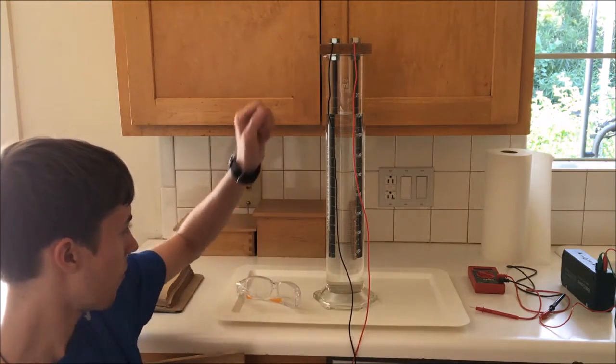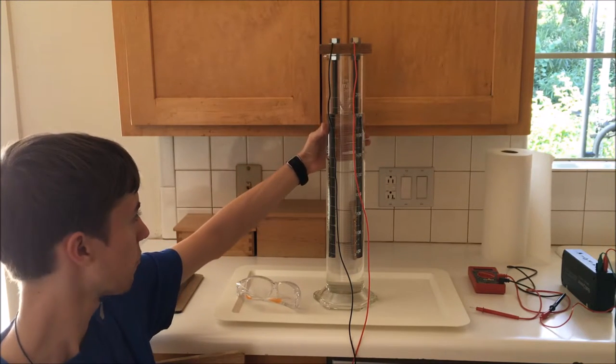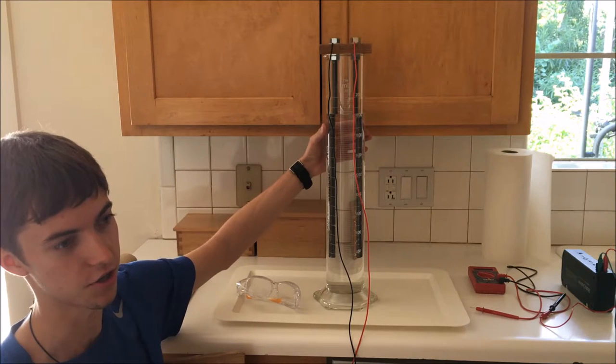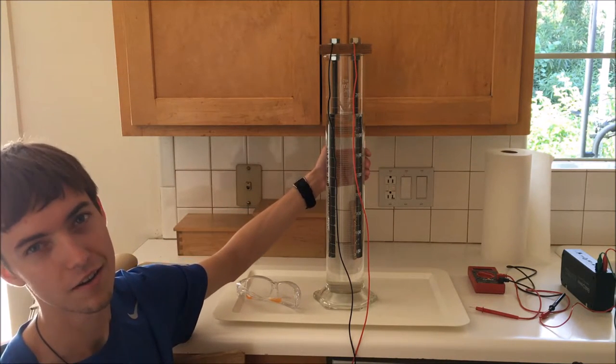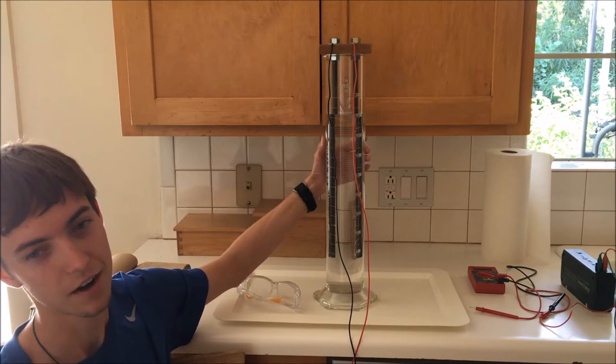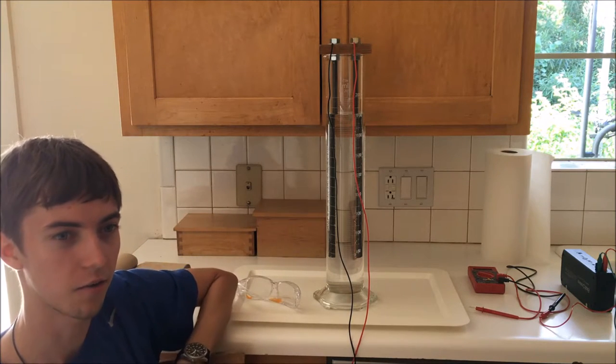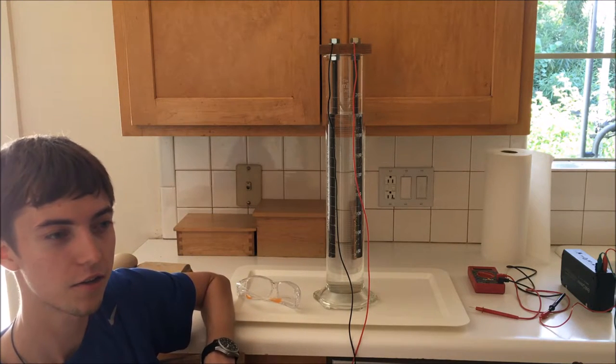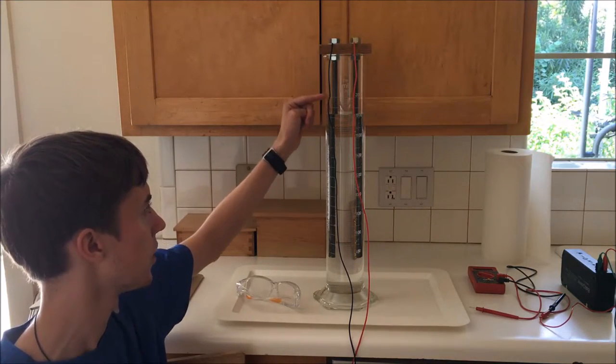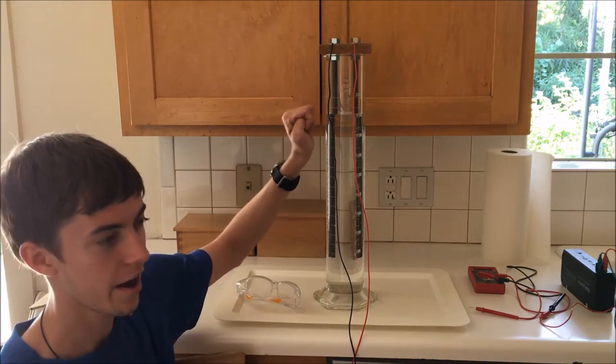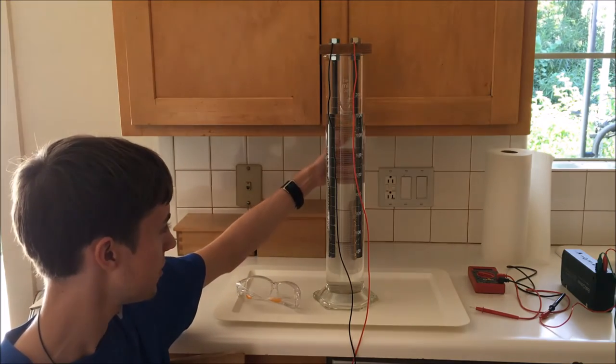What I have to do in order to make this work is crack the water molecules into hydrogen and oxygen. To do that, I have to pass current through it. As you know, distilled water is not a particularly good conductor. So I'll have to add some sodium hydroxide, or common household lye, to the solution to make it both alkaline, which will prevent corrosion of the electrodes, and make it conductive so that electricity can flow between these.